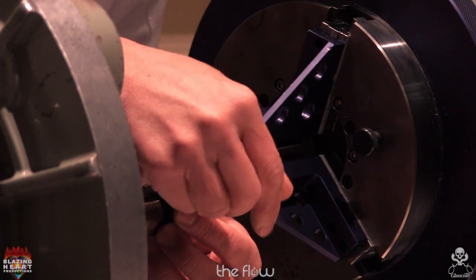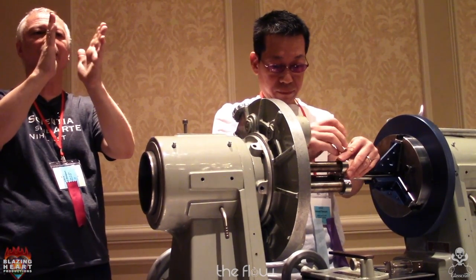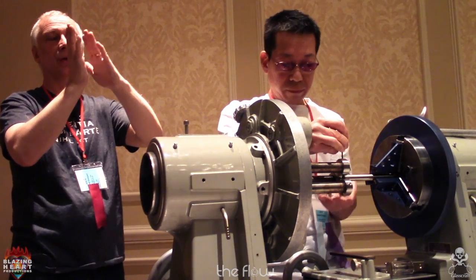And it's probably worth taking your time to get that right, because if one of those donuts is slipped back a little bit, then every single flange will be crooked.